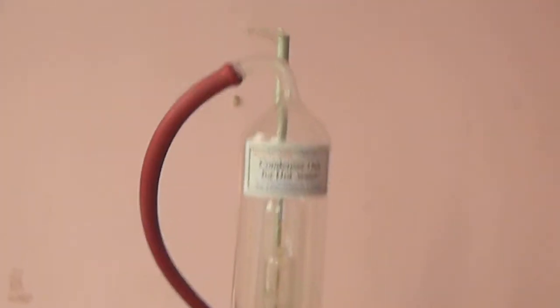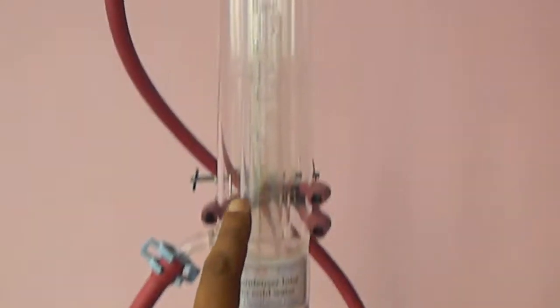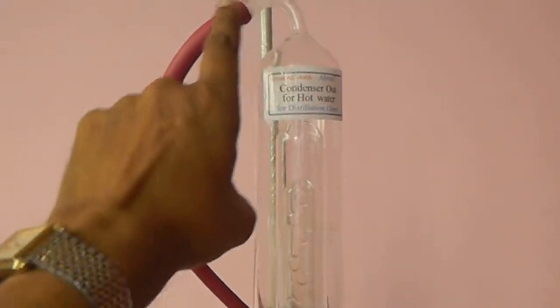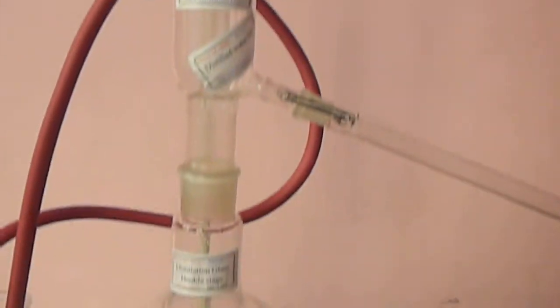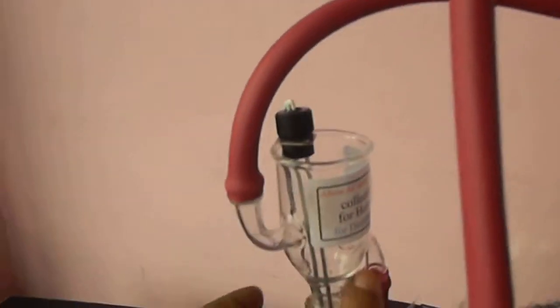This top has one inlet from the tap water which goes from here. Water goes to the top then comes out and then it goes to this chamber which is a cup.